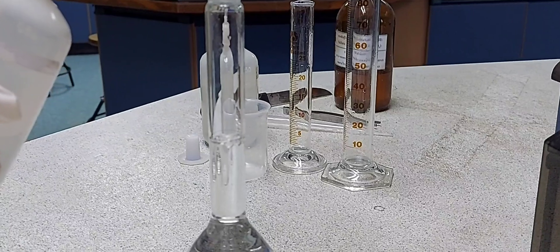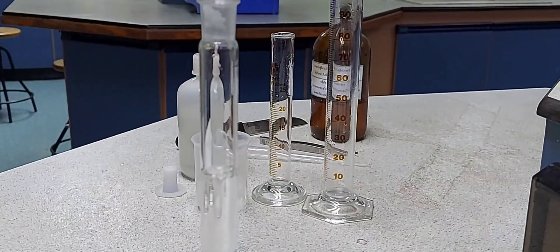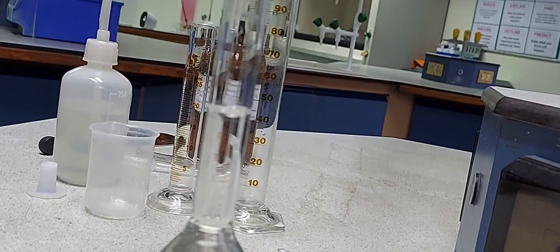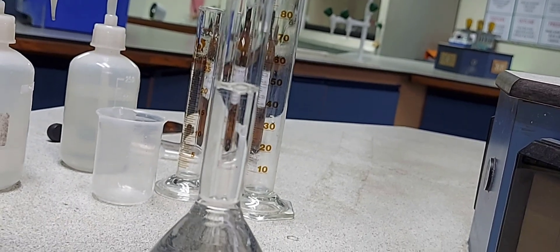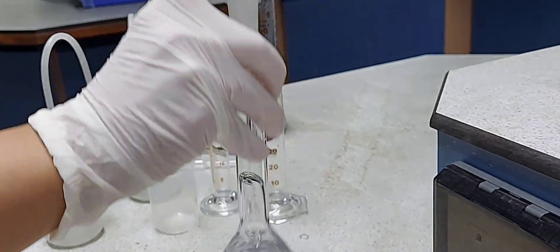So the solution is made up to the mark. And then you stopper the flask and turn it upside down a few times to mix the whole solution.